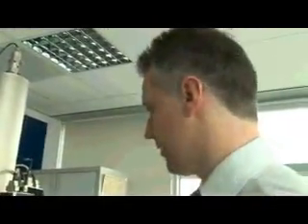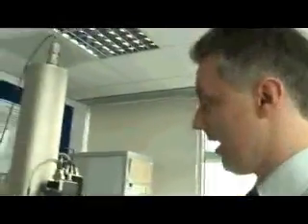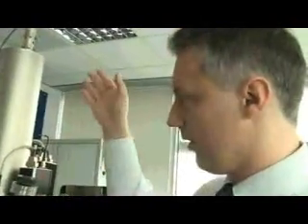Okay, so this whole instrument is actually called a secondary ion mass spectrometer, and it's designed to deliver a beam of ions towards the surface. Those are small particles. As those particles bang into the surface, they fragment off whatever is on our material, and those materials come out and are put into a mass spectrometer, which basically separates them out and tells us what each one of those components is made of. The reason it's in this steel chamber is because we have to do this experiment under vacuum. So we've pulled all the air out, so that those ions can travel to the surface and hit the surface.